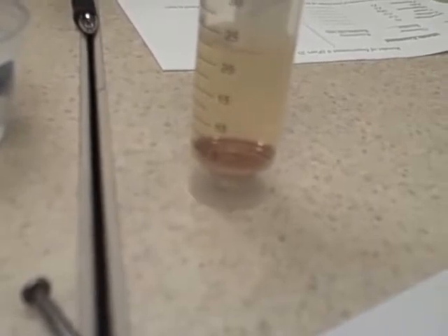All right. If we waited long enough, that copper oxide would all come off, or most of it would, and it would turn that solution a light blue. And then we could use those copper 2 ions in solution to coat the nail. But since we don't have forever, there is a cup of copper sulfate. For the kids, there's a cup of blue liquid in the middle of the table.